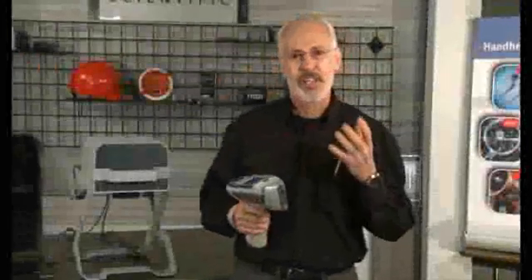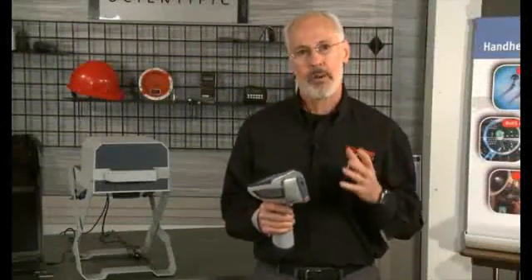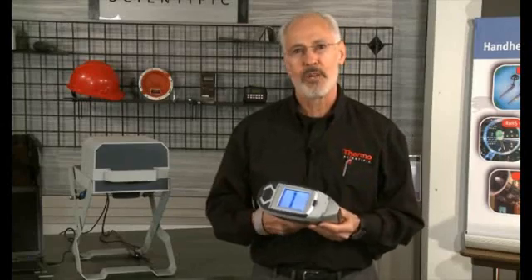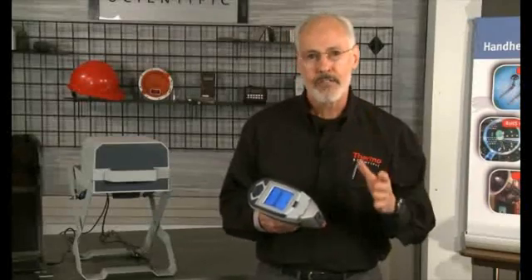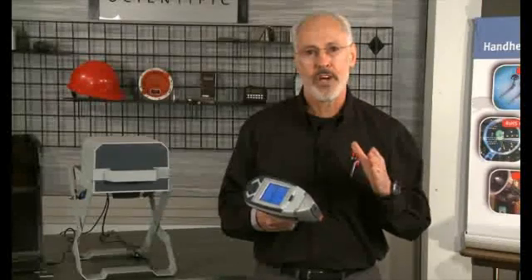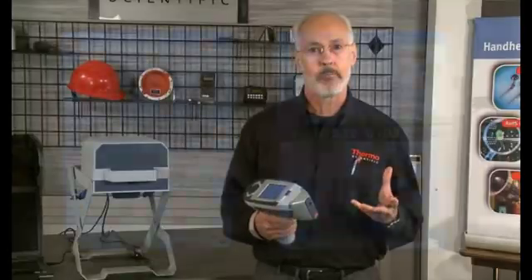The Niton analyzer has so much greater accuracy and precision than the allowable tolerance in the typical alloying min-max specs that the small amount of error associated with a 5-second test is almost always sufficiently accurate for a 100% confident ID. However, for comparing chemistries to a certified value, we suggest using 20 seconds or more of measuring time.